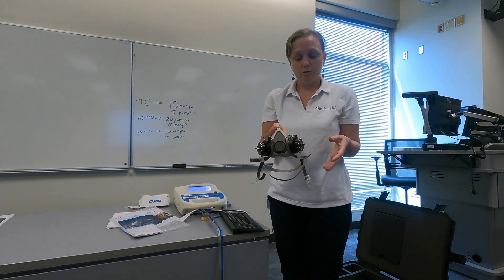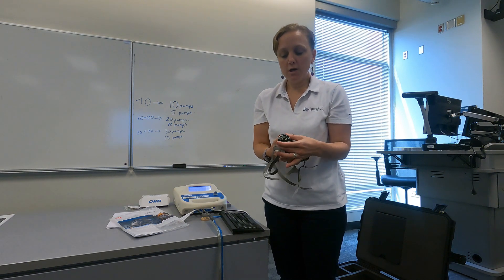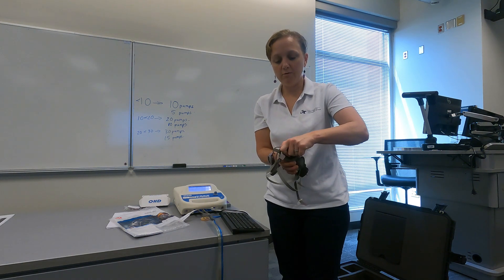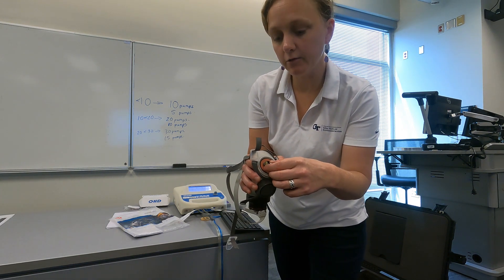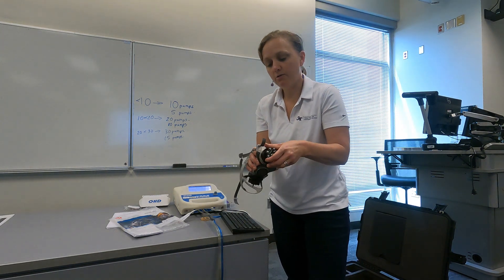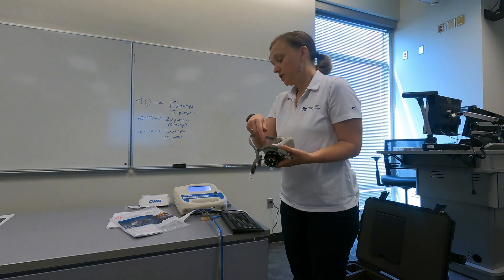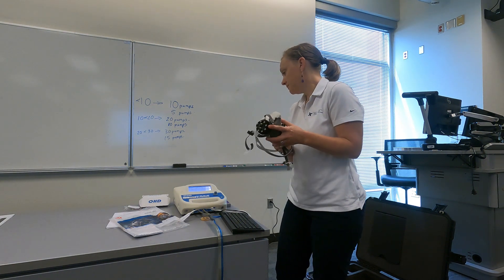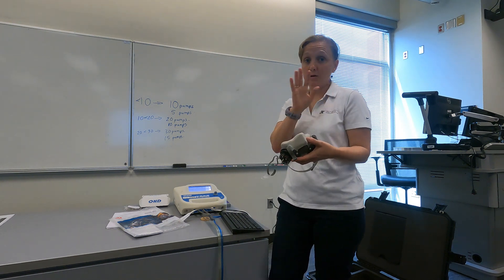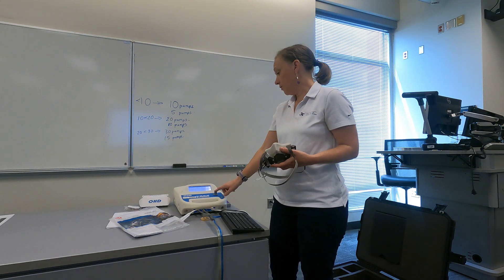A couple of things about doing quantitative fit testing with an OHD: first, you need special adapters for each of the different types and brands of respirators you have. Also importantly, you have to put little valve clips in to open up the valves of the respirator so the valves do not interfere with the fit test. I've made sure that the inhalation valves are propped open — they can be propped open with clips or completely removed.